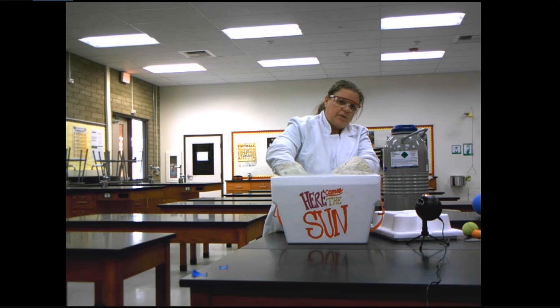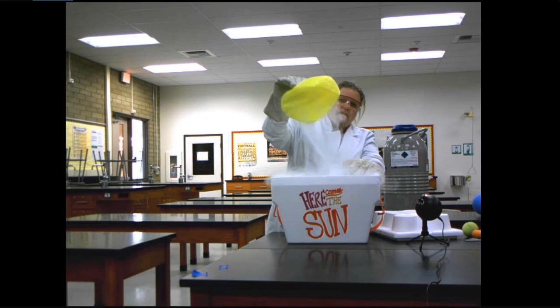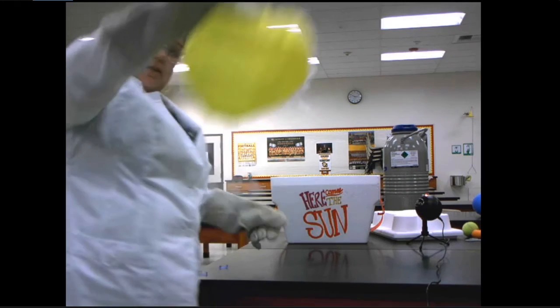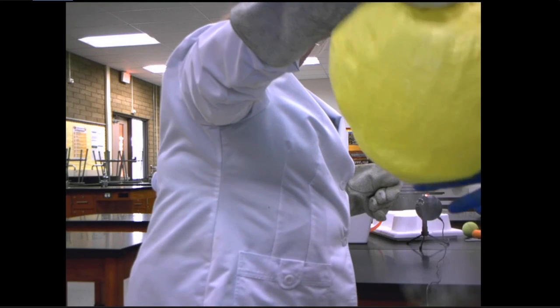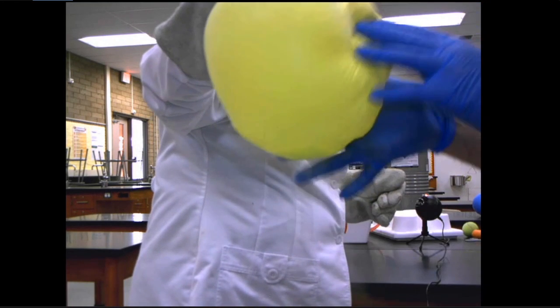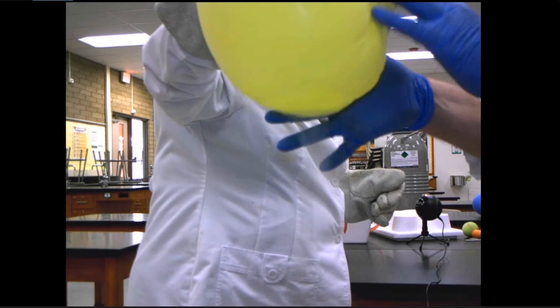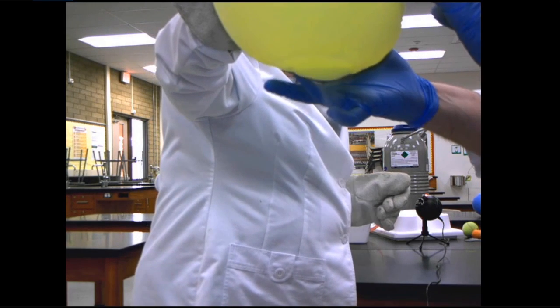So I'm going to pull this out. I'm going to show it to you, okay? So now the balloon is flat. And if you can see it, it's not only that, but it's steaming, okay? And it's also crackling. Look at the very bottom of the balloon. Okay, you can see there's a little bit of liquid on the bottom of that balloon. See that sloshing? Okay, where did that liquid come from? See that right here where my finger is.